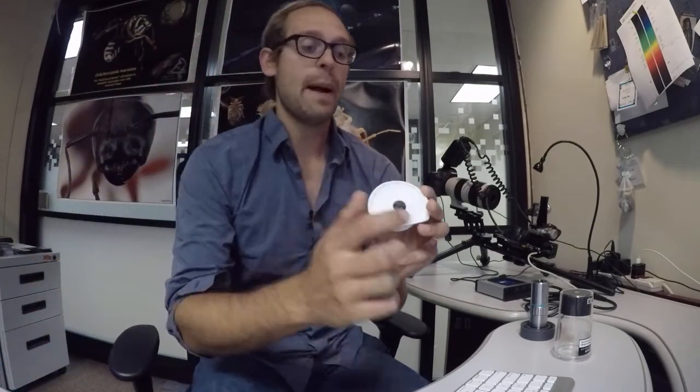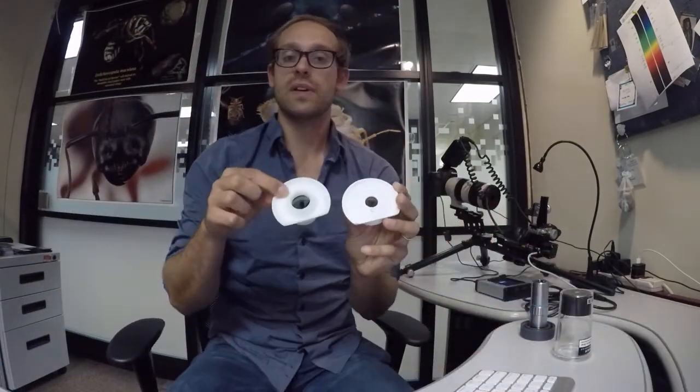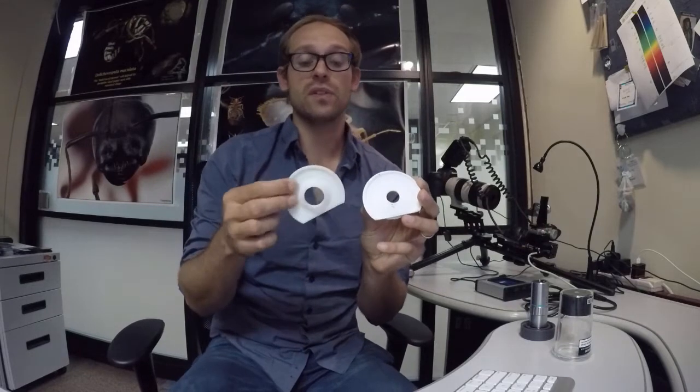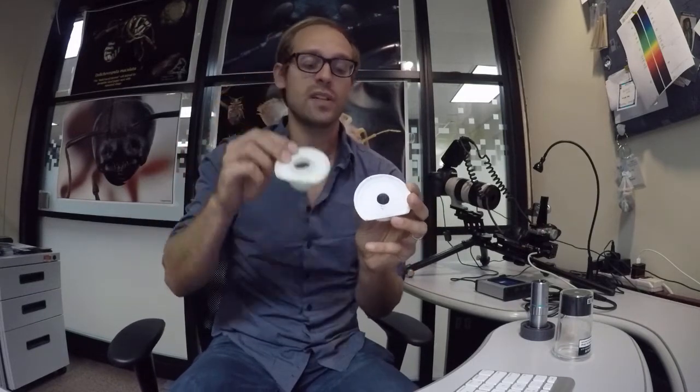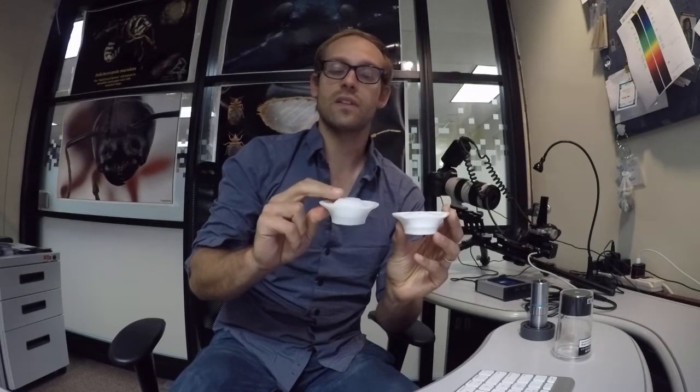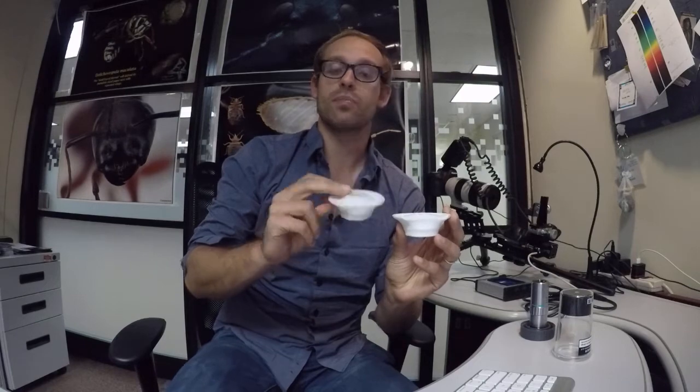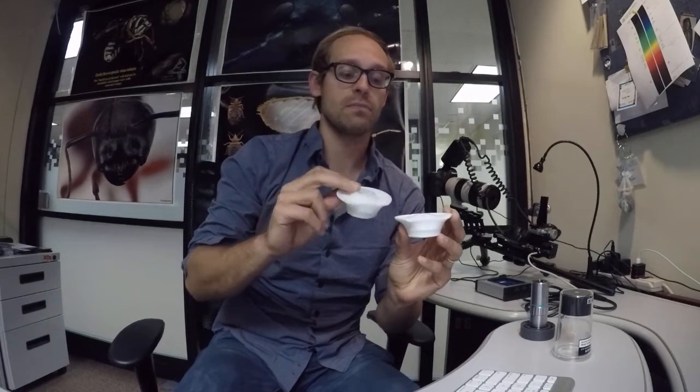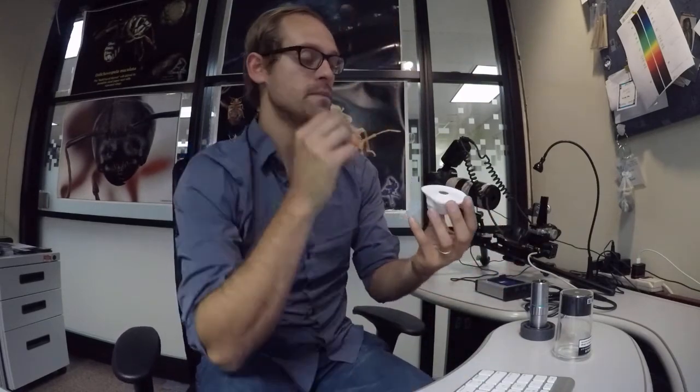You can see the aperture is a lot smaller. That's because the field of view isn't nearly as large as it is with a 10 or 20x objective, and at the same time, if you look at it horizontally, you'll see that the shade doesn't protrude out as much as it does on the 10 and 20x objective diffuser.